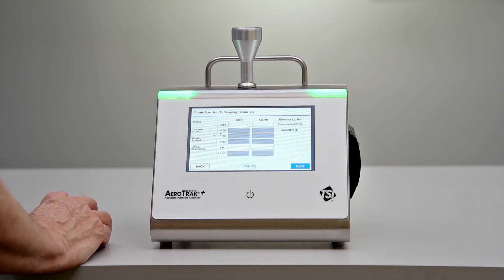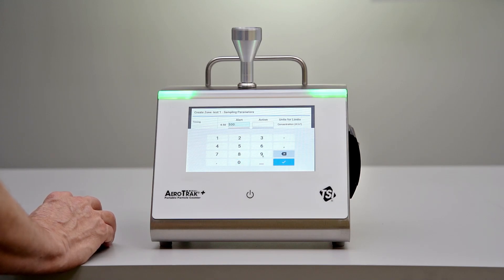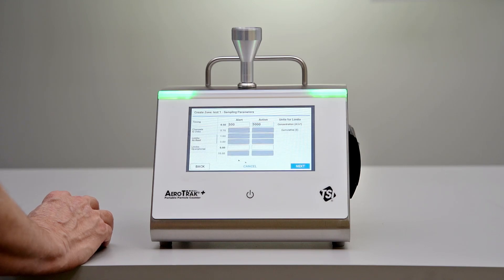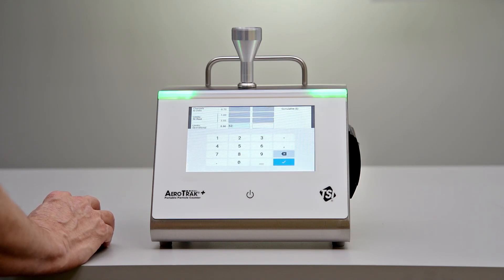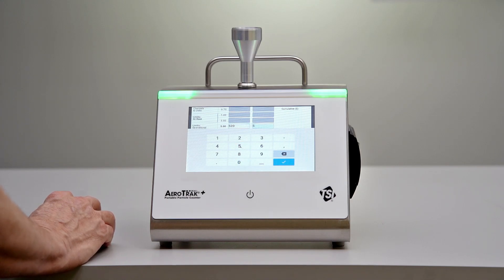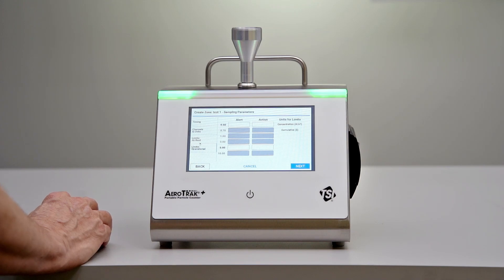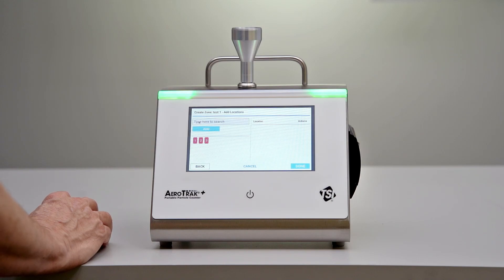We control our displayed channels and units here — I'm just going to do 0.5 and 5 micron. We'll put in our limits for alarming purposes, and these are driven by whatever your SOP has for your facility. I'm just going to throw in a couple of numbers — you can obviously put whatever you want per your SOP for the limits for these different sizes.